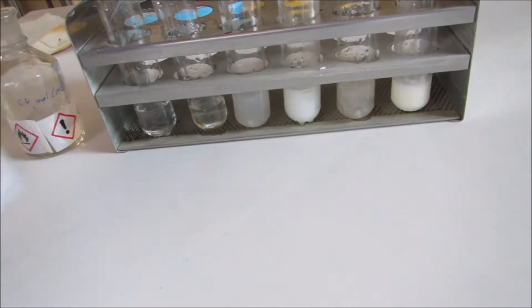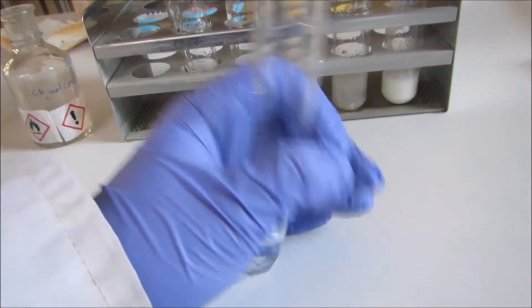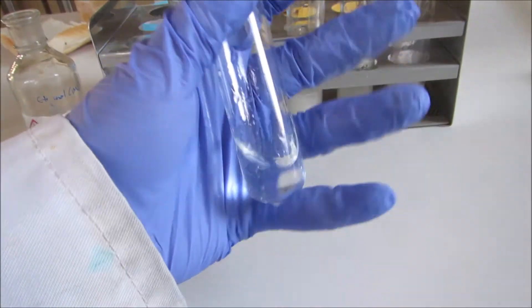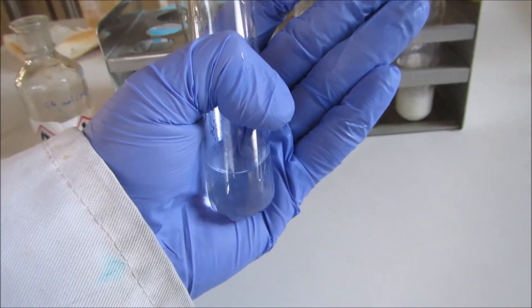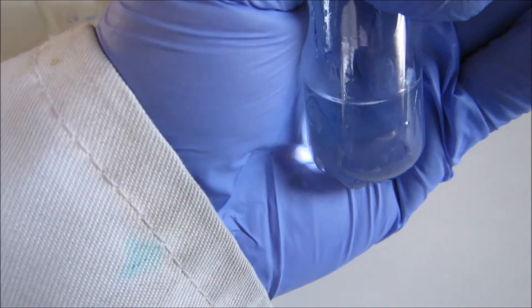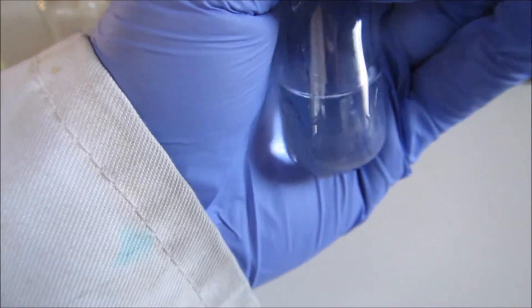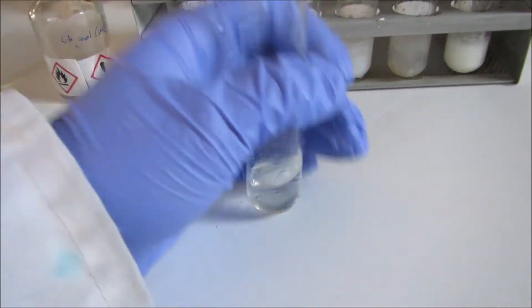Hopefully that's enough. So to our first one — if I give it a shake, you can see it's kind of one layer. It looks much the same as water, so there's been no reaction. That was our water.